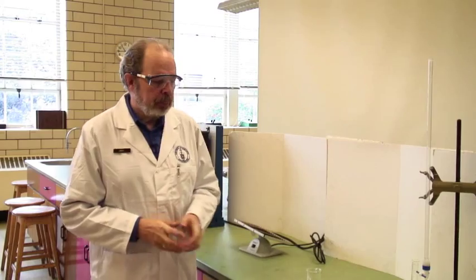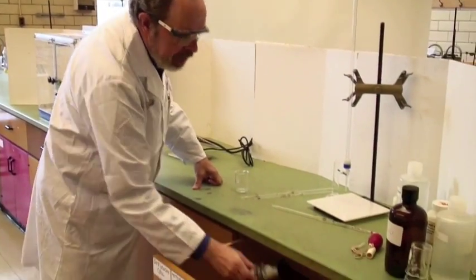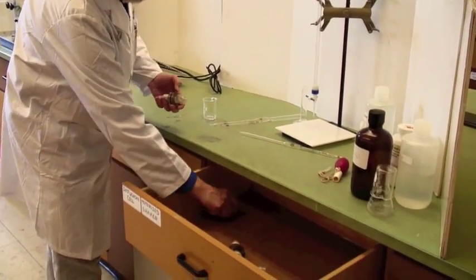This video is to show you how to use the equipment for experiment E2 membrane diffusion. The diffusion cells are kept here, and they look like this.